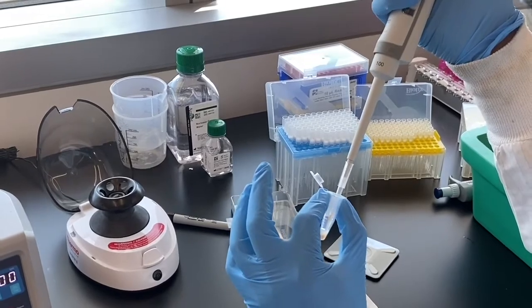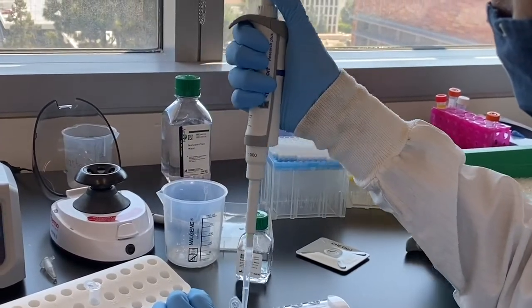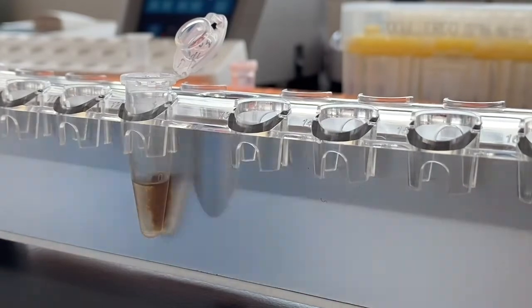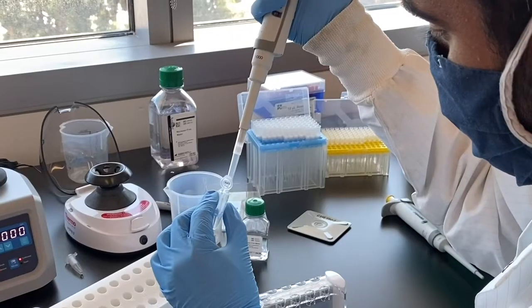Then we use magnetic beads to purify our library. We use two bead purification steps to isolate fragments between 100 and 200 base pairs.